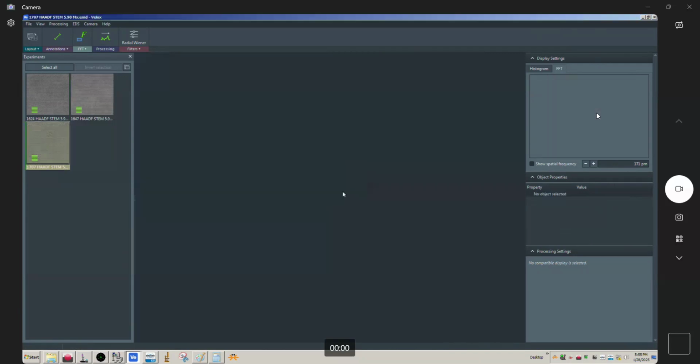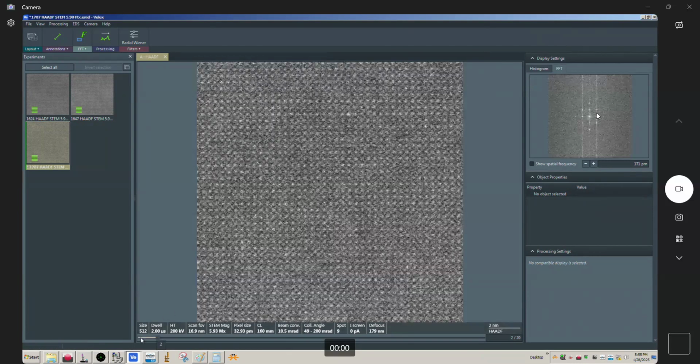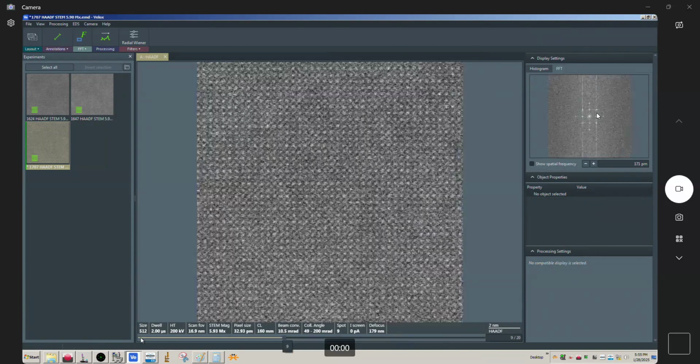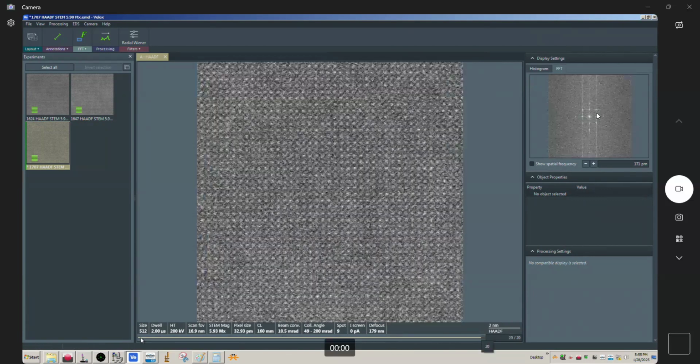Okay, and I actually have that right here. So this is now 512 by 512, 2 microseconds a frame. We're not really losing any detail in the picture. Okay, you can see in the FFT my Nyquist limit isn't as big as it was, but based on the magnification and the size of the pixels, I'm not really losing any detail in the picture, okay? And now if I cycle through this, you can see, because my time per frame is much smaller, the shift per frame is a lot less, okay? It's much, much less now than it was before, okay?